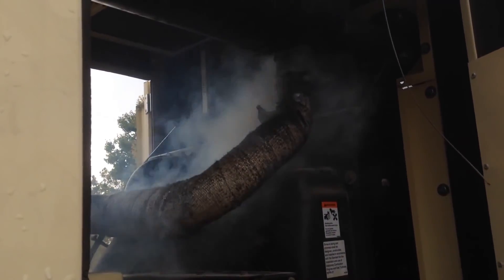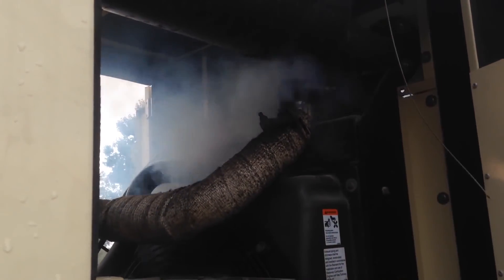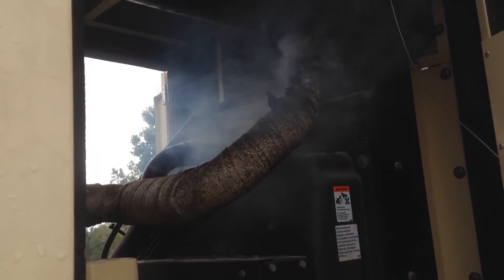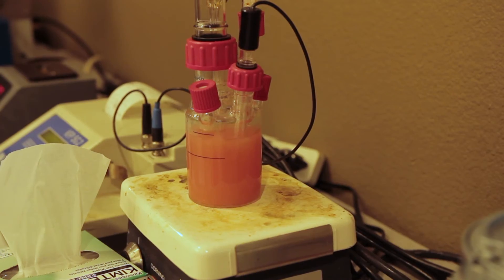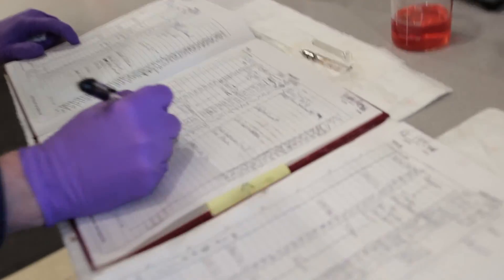Dangerous levels of water contamination can be difficult to see visually, which is why a water by Karl Fischer test can be vital to determining this information before you experience equipment failure.